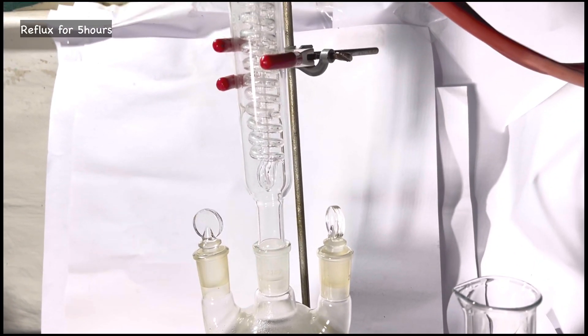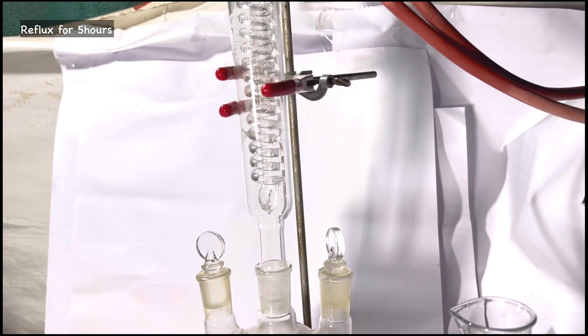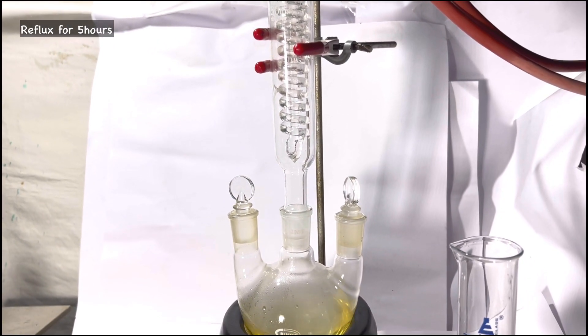Once the THF is also added, slowly heat the flask and then reflux the contents of the flask for approximately 5 hours.